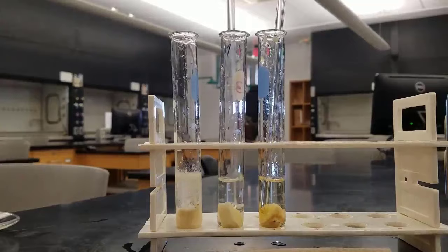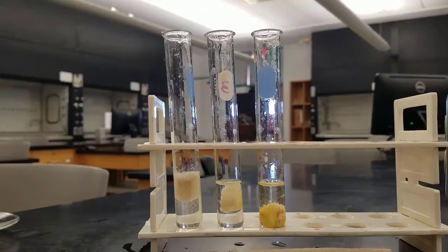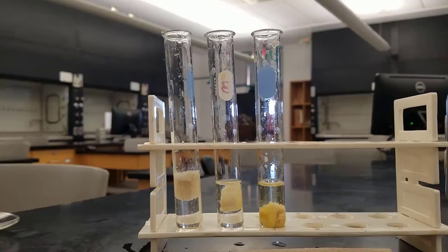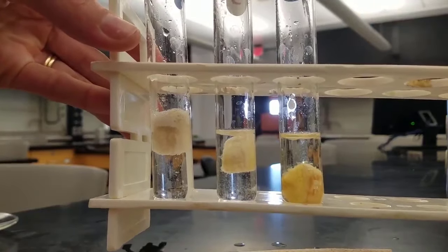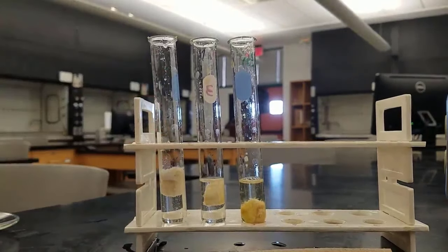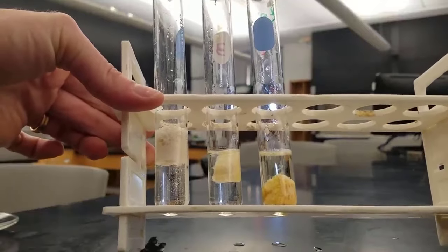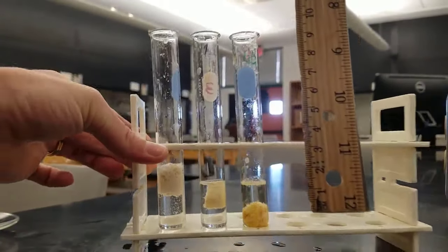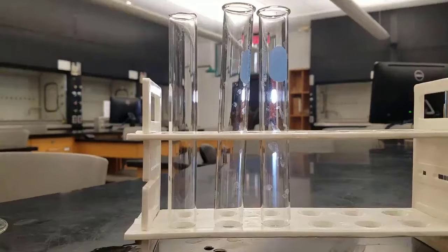We're going to stir it up just a little bit in each test tube to make sure the liquid gets mixed in and encounters that banana. What you want to be watching for is bubbles — if bubbles are showing up, that means our catalase is breaking that peroxide down. You can see a thick layer of bubbles showing up at the top of test tube one, but over on the right we don't really see any bubbles. After a few minutes, you can see a lot of bubbles form in that first test tube — roughly about two centimeters of bubbles when we had just the water present — but we didn't see anything in the others.